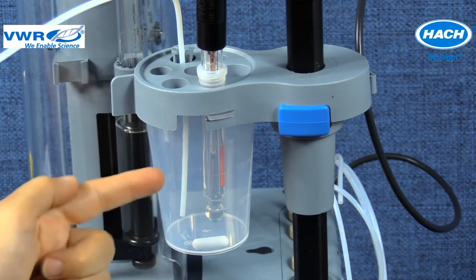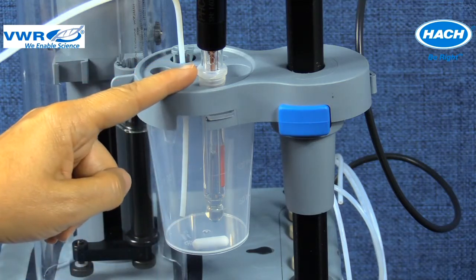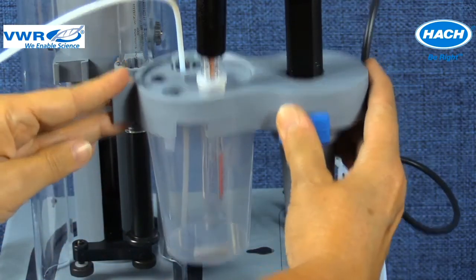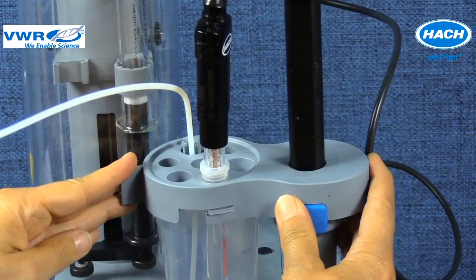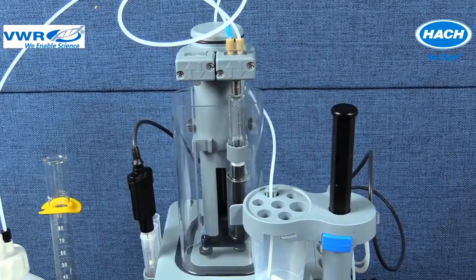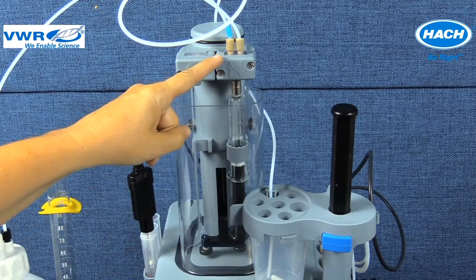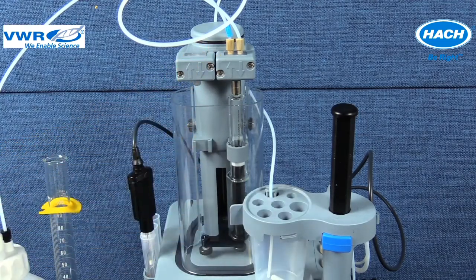PHC 805 pH electrode is a refillable probe. It is important to confirm that there is adequate filling solution and the filling hole is open during the titration. A 10 ml syringe is installed in position 2 as detailed in the application notes, because of the location of this application in the second row of the home screen.